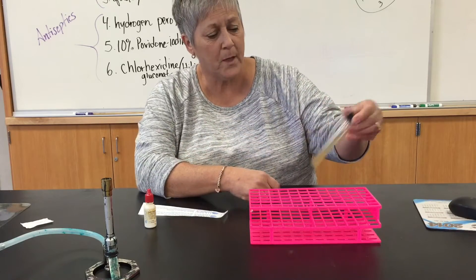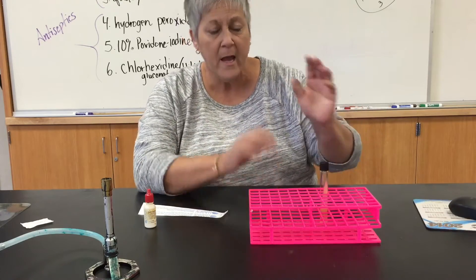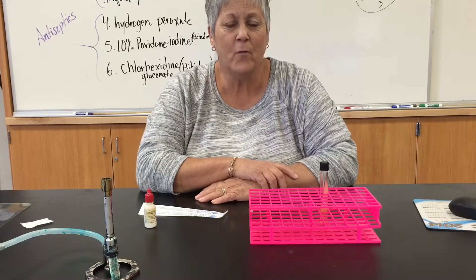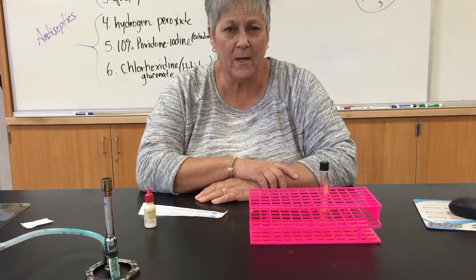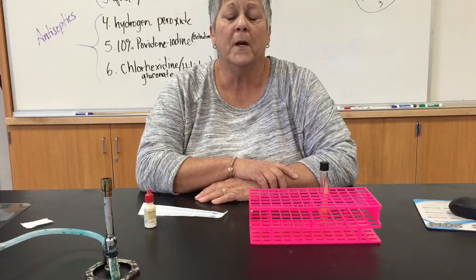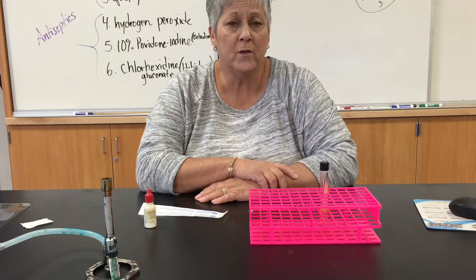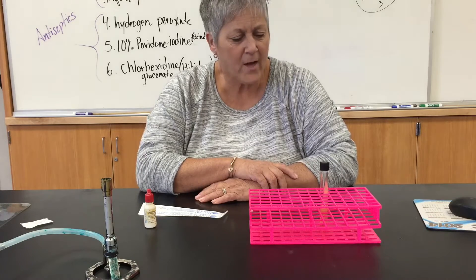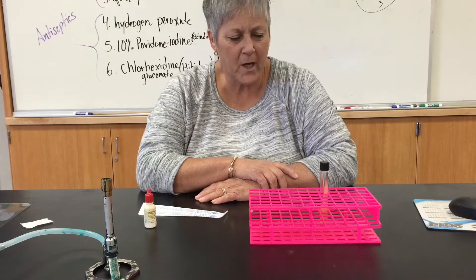It's a slant, nothing much to look at. I am not using any live organism in this demonstration. I will attach photos of a positive and negative reaction at the end of the video.